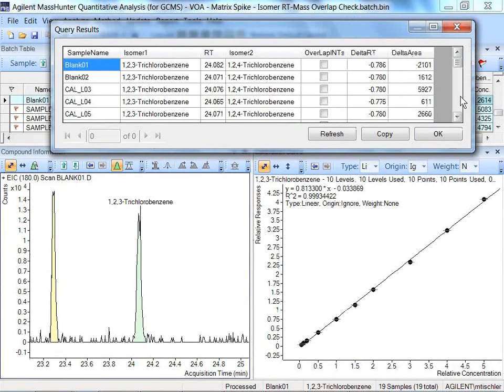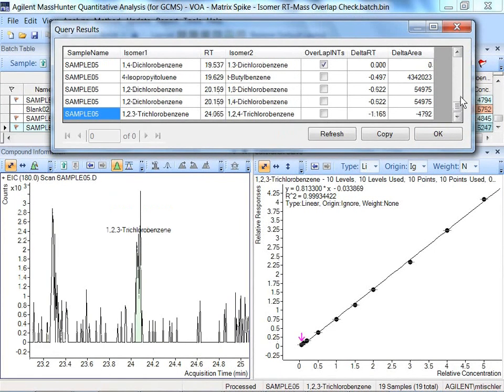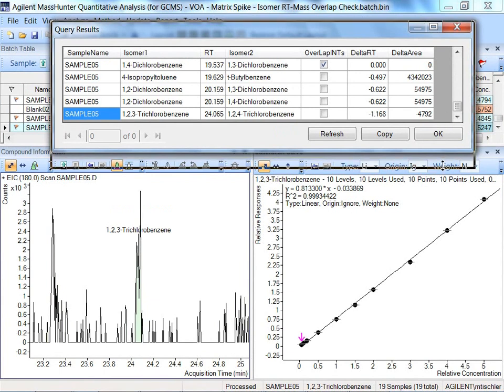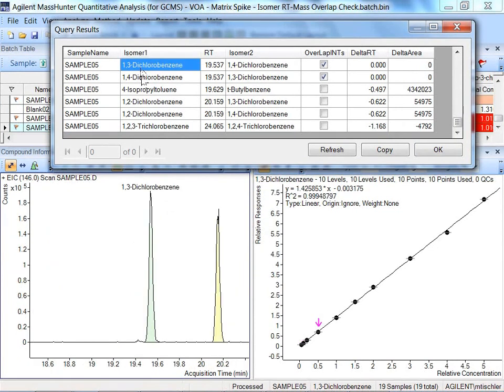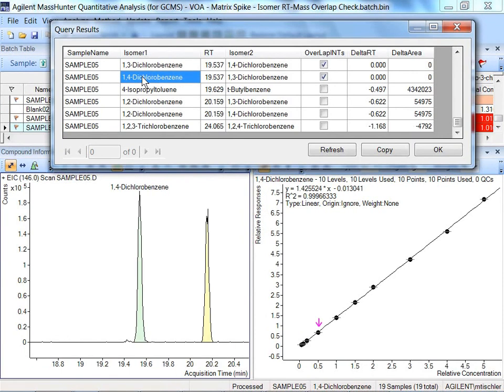And let's drop to the bottom and look at sample 5. Let's look at the case that I mentioned, where the delta area is 0 and the delta RT is 0, and you can see 1,3-dichlorobenzene and 1,4-dichlorobenzene are actually pointing to the same result.